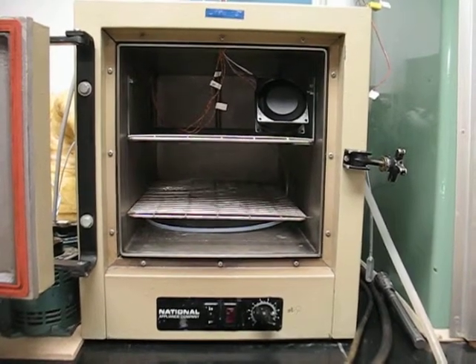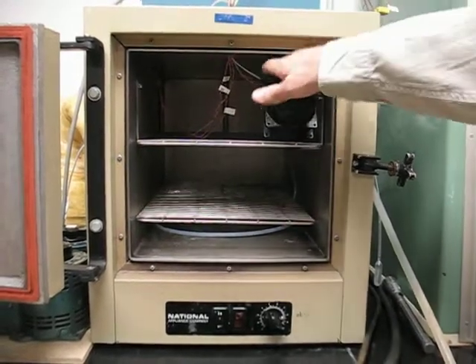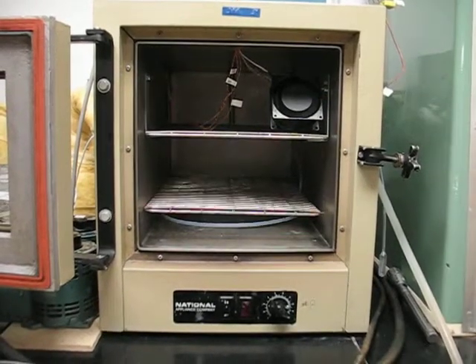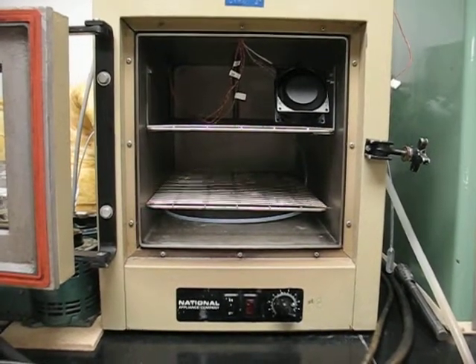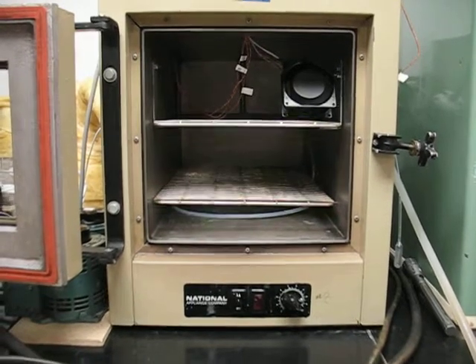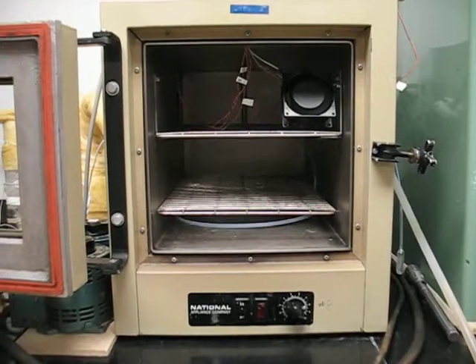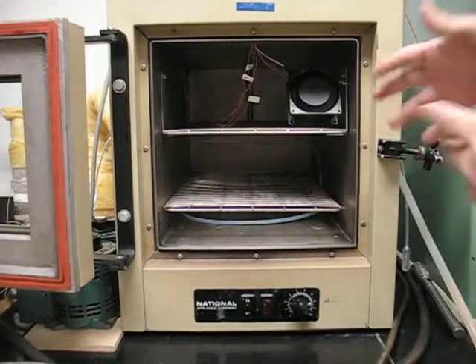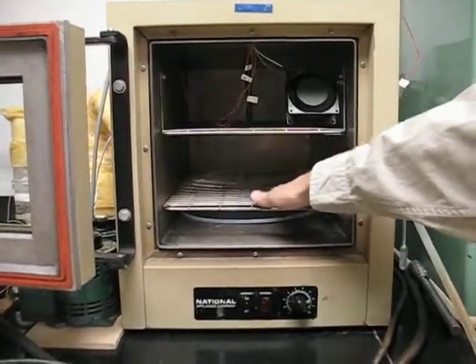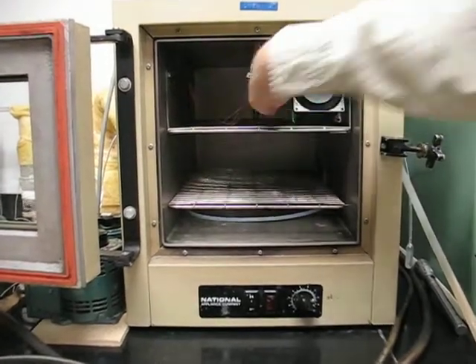We will be arranging the bottles so there's no bottles directly being blown on, both for fear of blowing the compound out of the jar, and we don't want something directly in the wind field while the rest of them aren't. So for consistency, we'll have a gap here where it's primarily blowing, and a gap right behind it also.